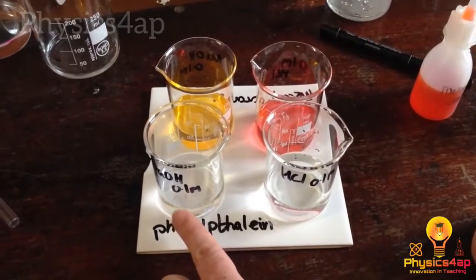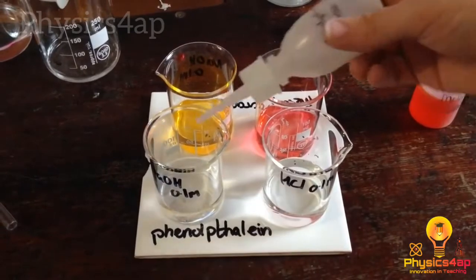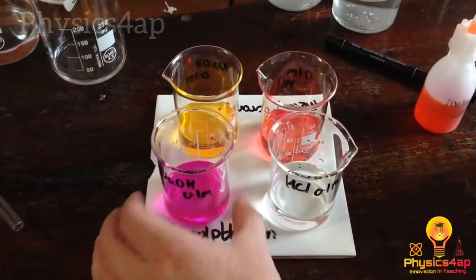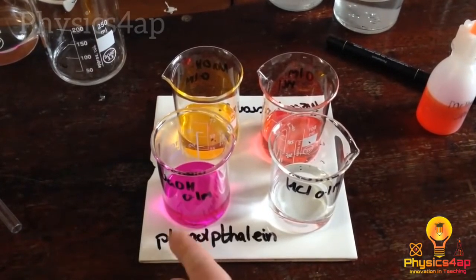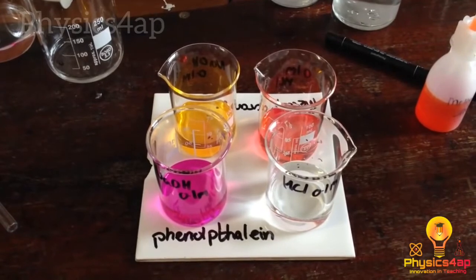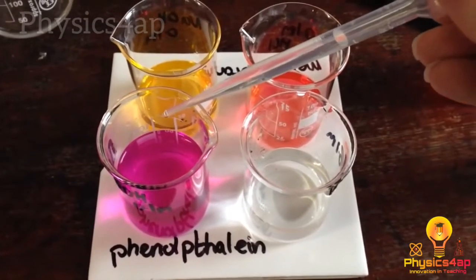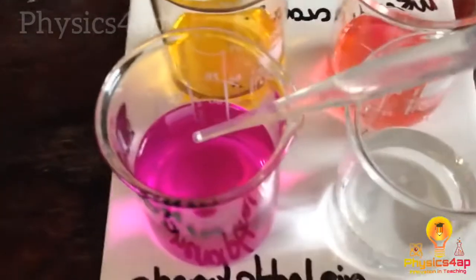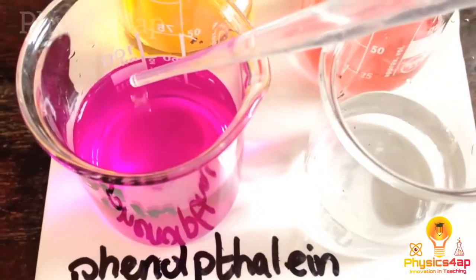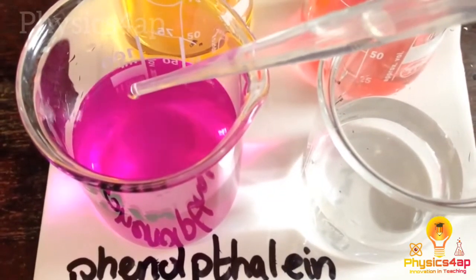Here we have the first one sodium hydroxide and the second HCl, hydrochloric acid, and we are pouring phenolphthalein solution. As it converted into pink. And in HCl, as there is no change, we call it a colorless solution here. And if we add some amount of HCl into the phenolphthalein solution, there you can see gradually the change of the pink color, which converts into a colorless liquid.